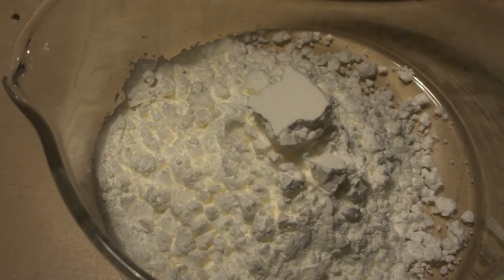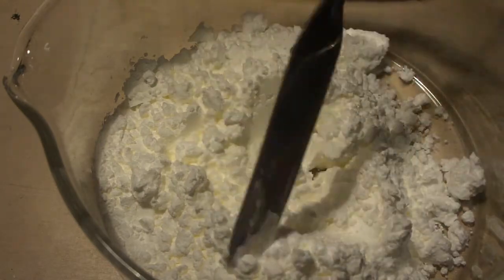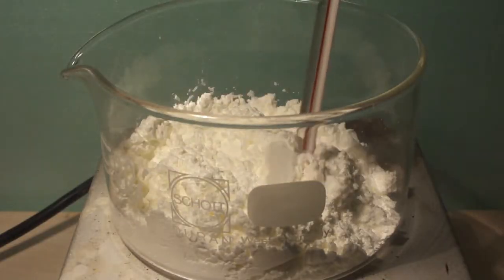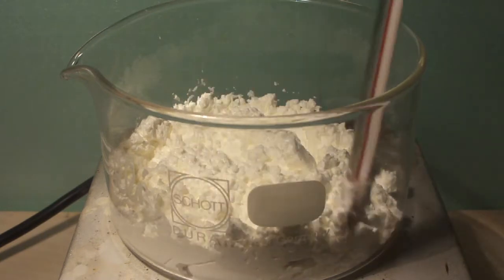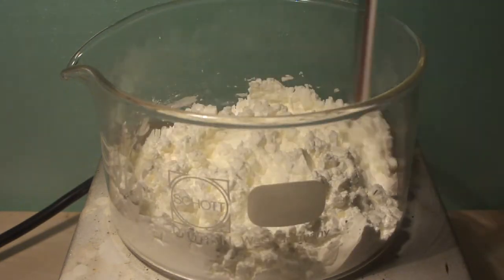The preparation is very simple. Just add some starch to a shallow dish and heat it on a hot plate while stirring with a thermometer. We have to keep the temperature between 180 and 200 degrees centigrade until a brownish color develops.